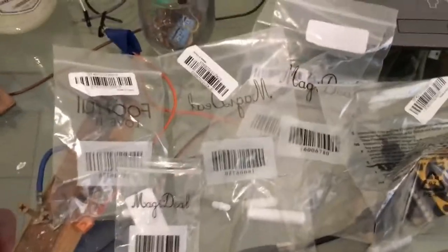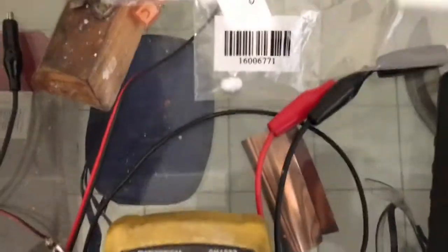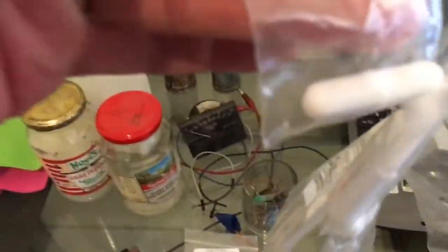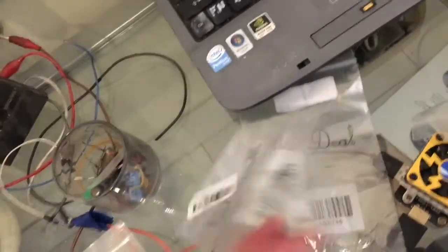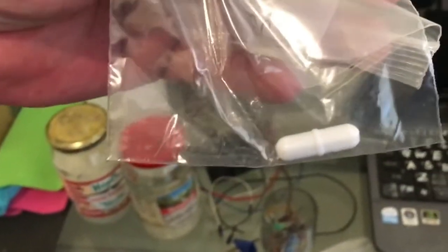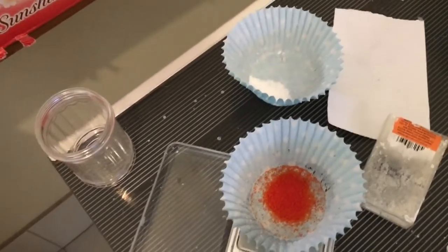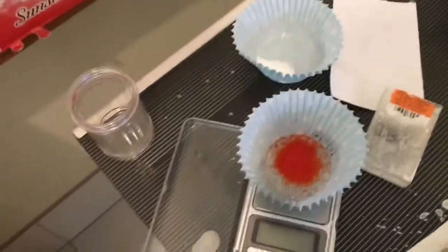I've got my stir bars. I've got six stir bars of various sizes for $11 Australian, which ain't too bad. They're magnetic. I tested one out and they work actually even better than that little steel rod I have. So I reckon I'm going to go for that size one. I'll mix this stuff up in its solutions and then I'll get to work.